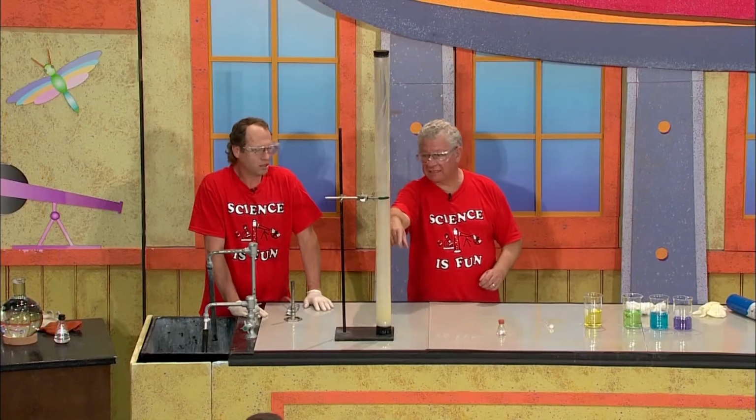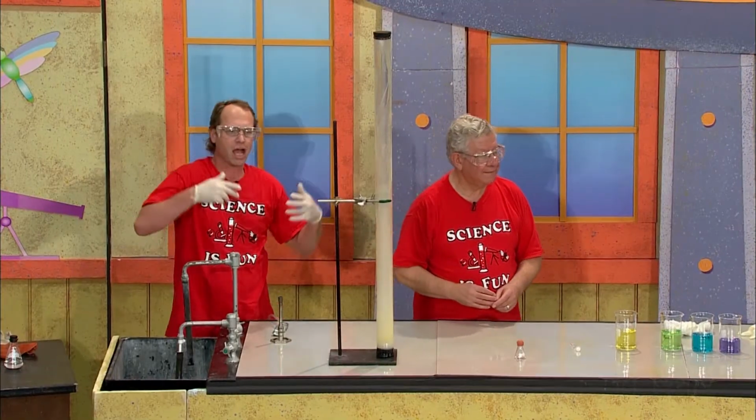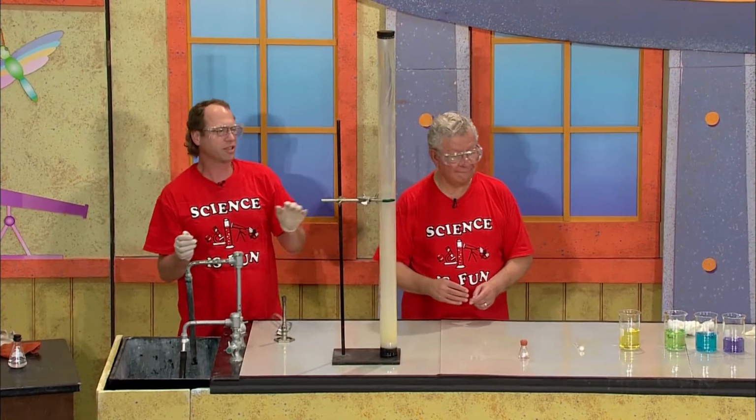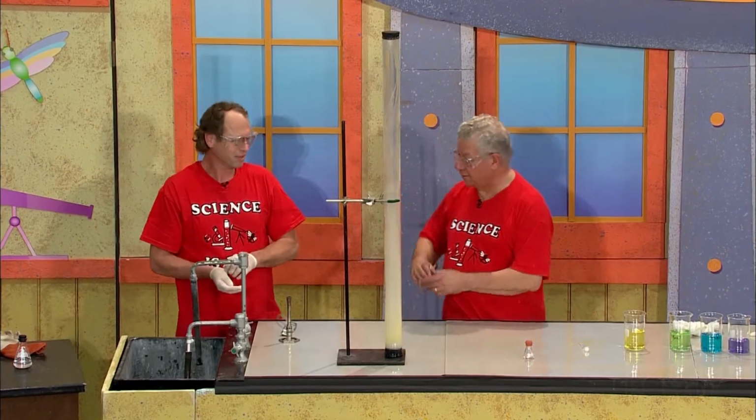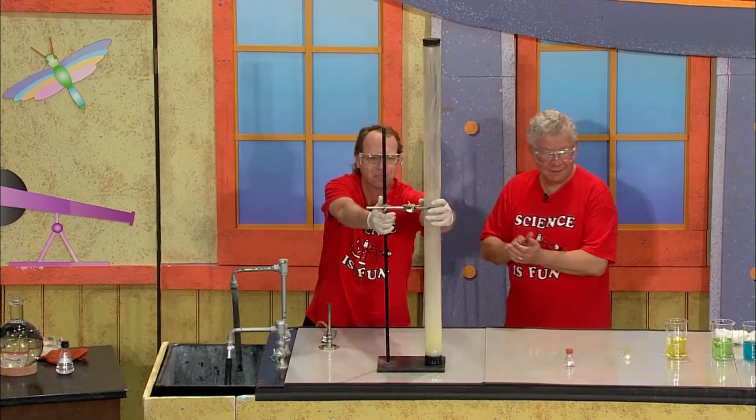Now, what's this yellow stuff on the inside of the tube? Yeah, this yellow stuff on the inside of the tube is sulfur. So this reaction starts out with the carbon disulfide and the nitrous oxide, and you get nitrogen, carbon dioxide, and sulfur. I like this demo for two reasons. One, it's very spectacular. And two, Le Chatelier himself, of Le Chatelier's principle, used to do this very demo in front of his students over a century ago. Thank you very much. Fabulous.